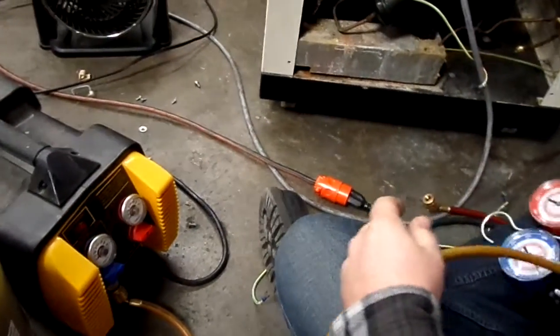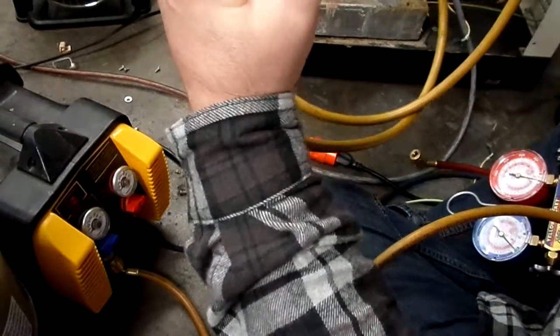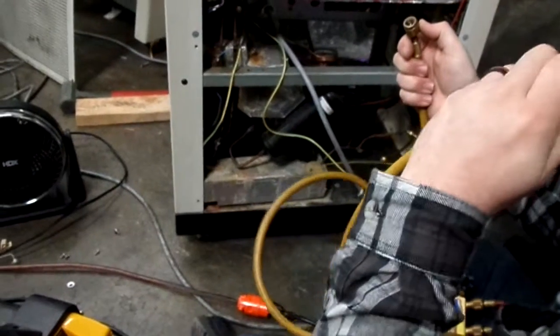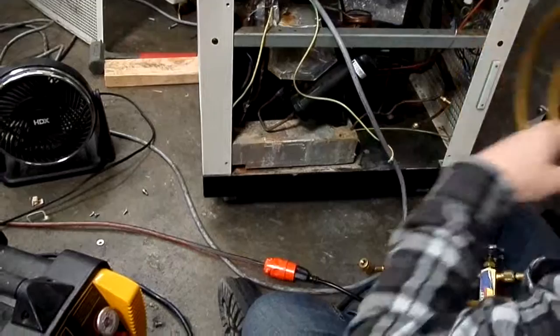And before we hook that up too, I should pull. Oh, this is low loss. That's not low loss. Is there another hose anywhere?